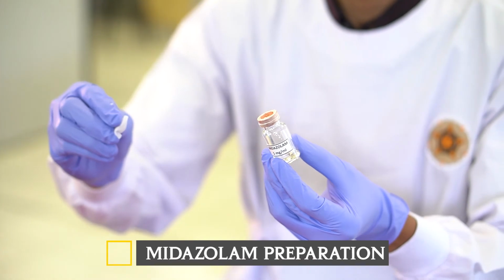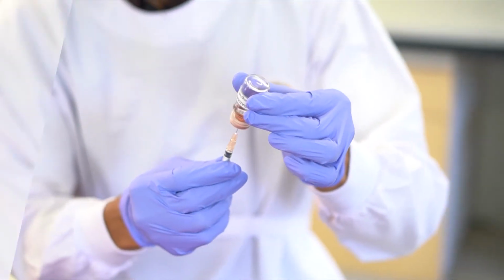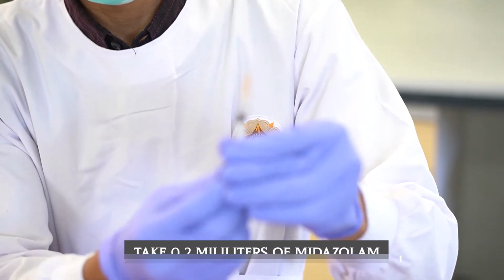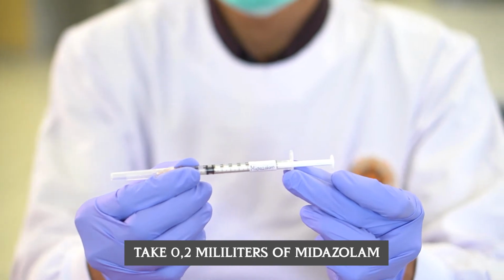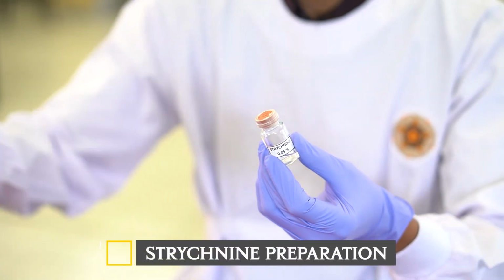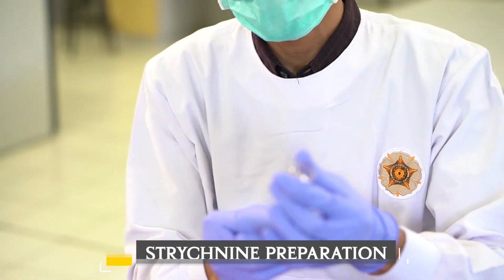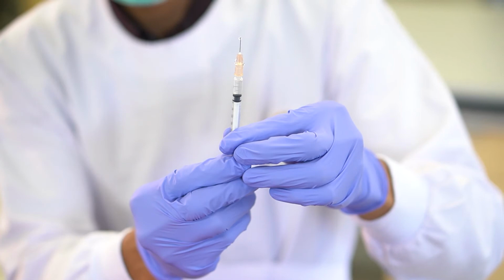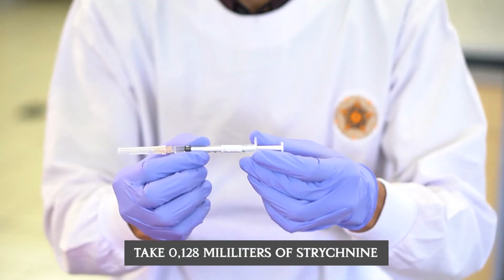Midazolam preparation: take 0.2 milliliters of midazolam. Strychnine preparation: take 0.128 milliliters of strychnine.